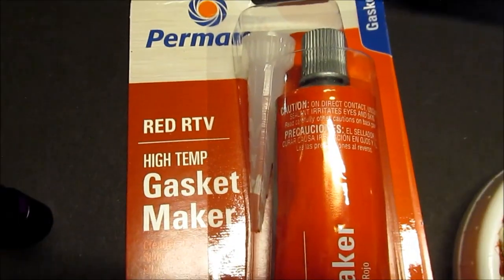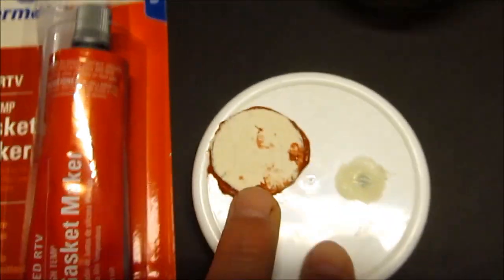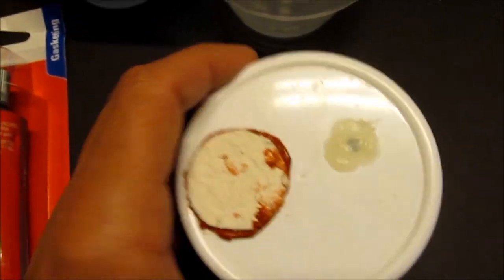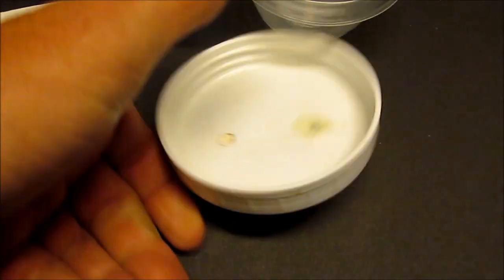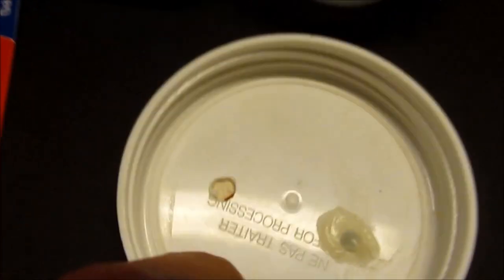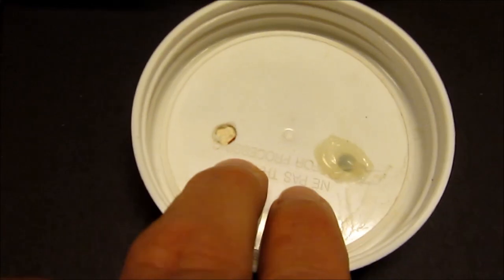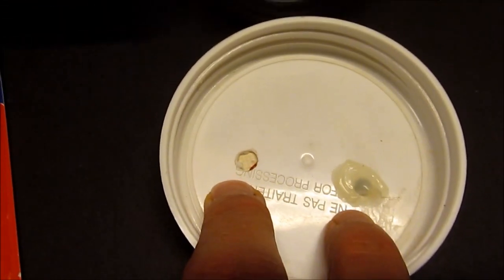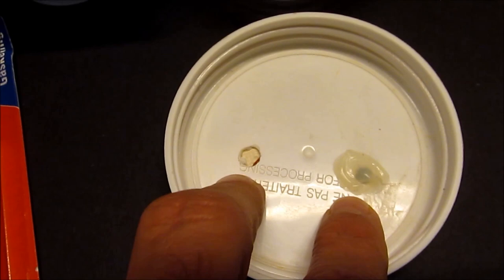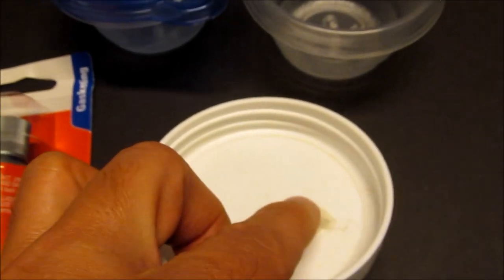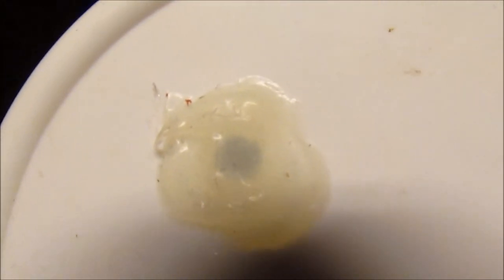It's just silicone plug and micropore tape on the top of the mini round Glad mini rounds. We're going to mix up some agar, pour it into the bottom of these, and then put them in the pressure cooker. People were asking about the mycelium jar lid. Let me give you a quick rundown. It's one of the reusable canning jar lids. Backside has two holes, each one of them is one quarter inch in diameter.